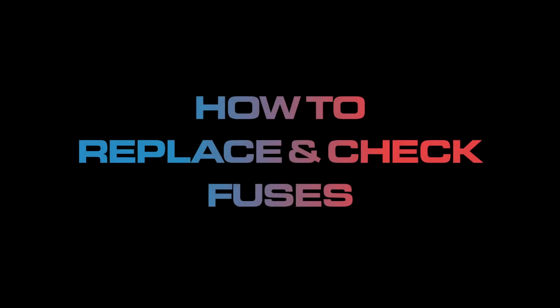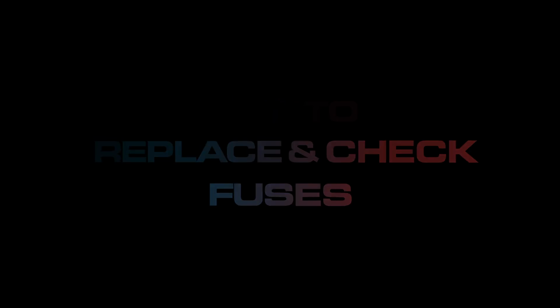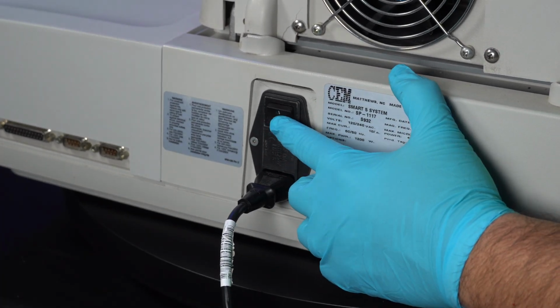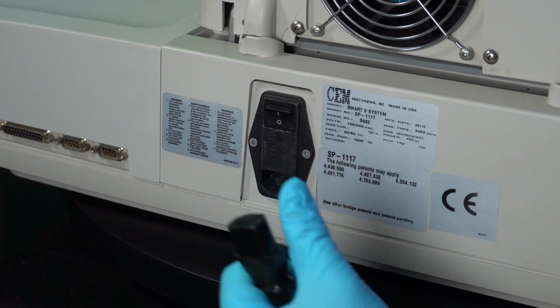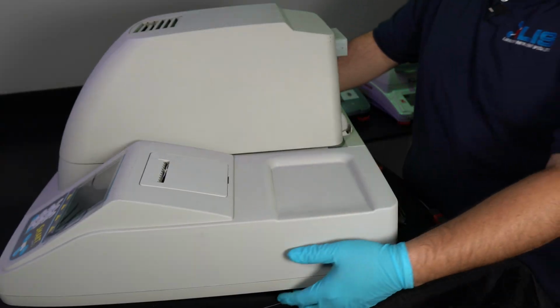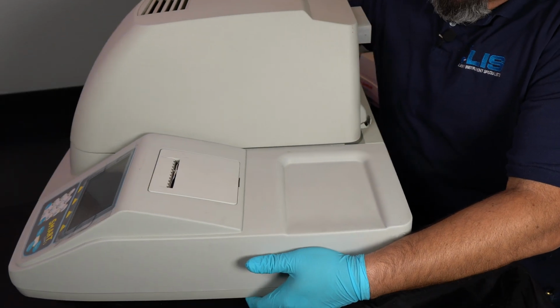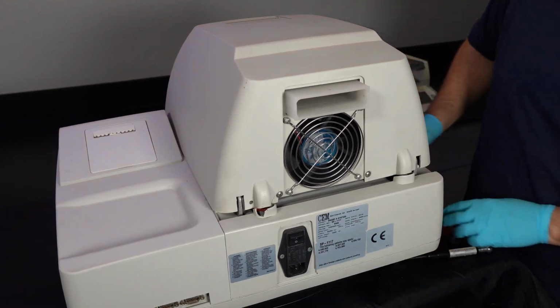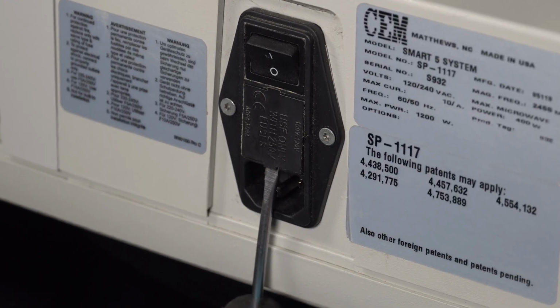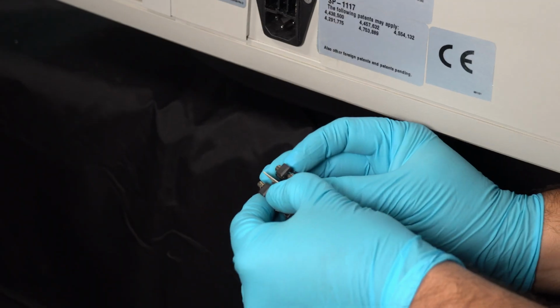If your CEM Smart System 5 displays a thermal overload or the instrument shuts off unexpectedly, verify that the fuses are not blown. First thing to do is turn the instrument off and unplug the power cord. Bring the instrument to the very end of the table for this next step, as it will help with leverage. Grab a flathead screwdriver and pop the fuse holder out.